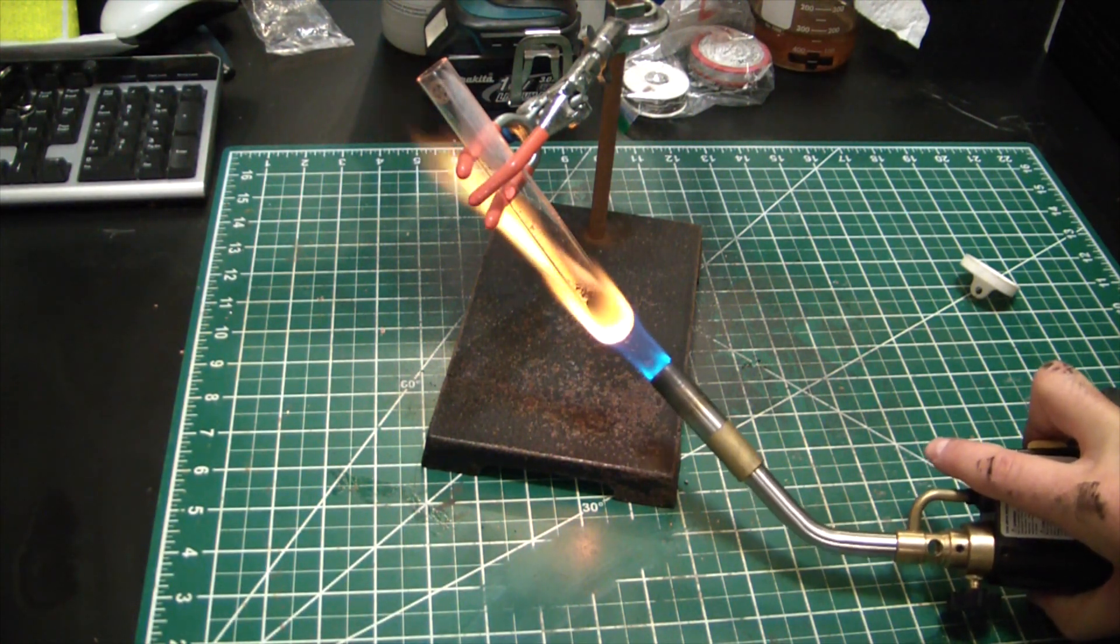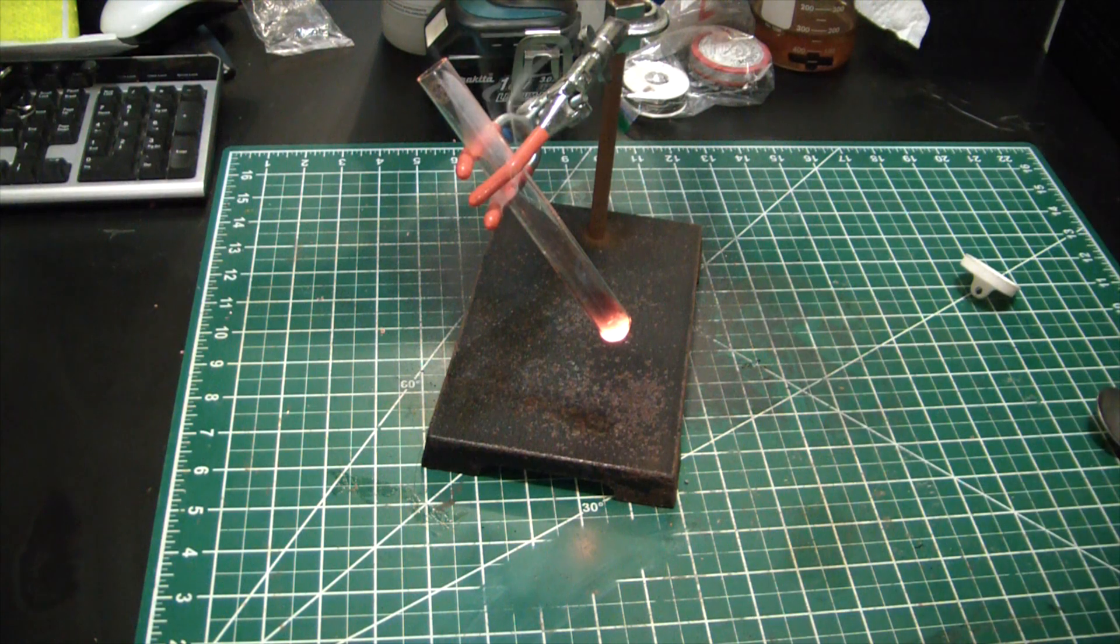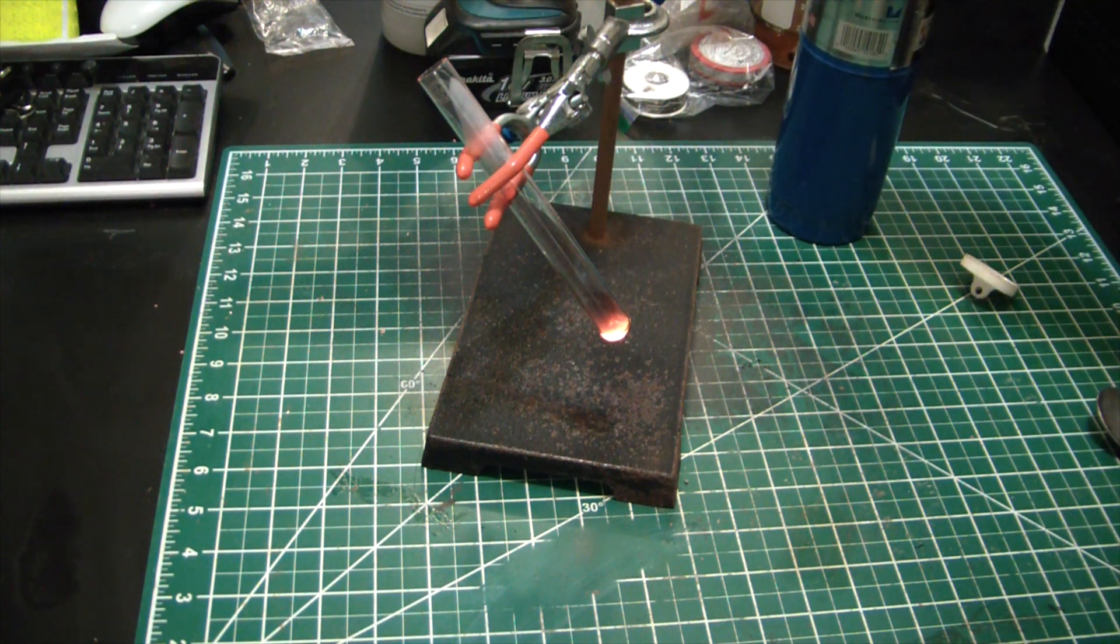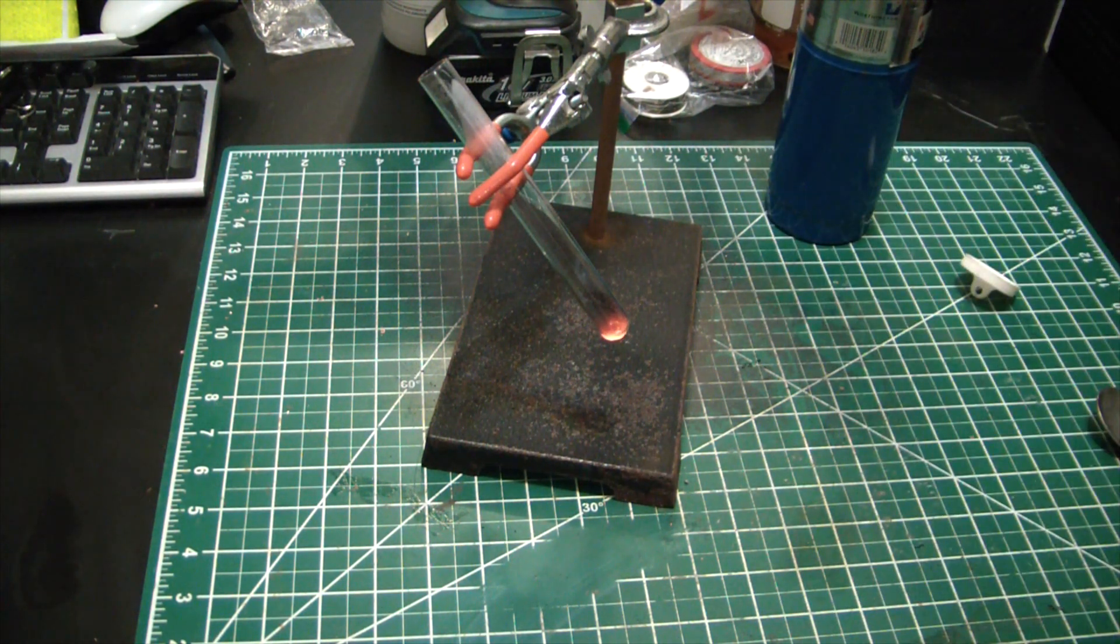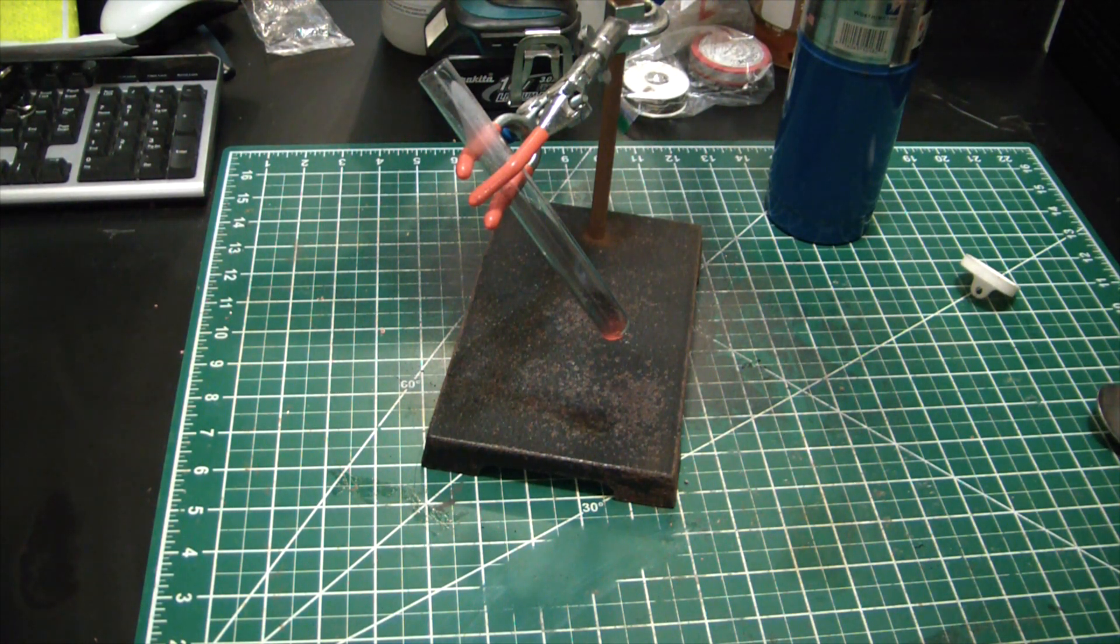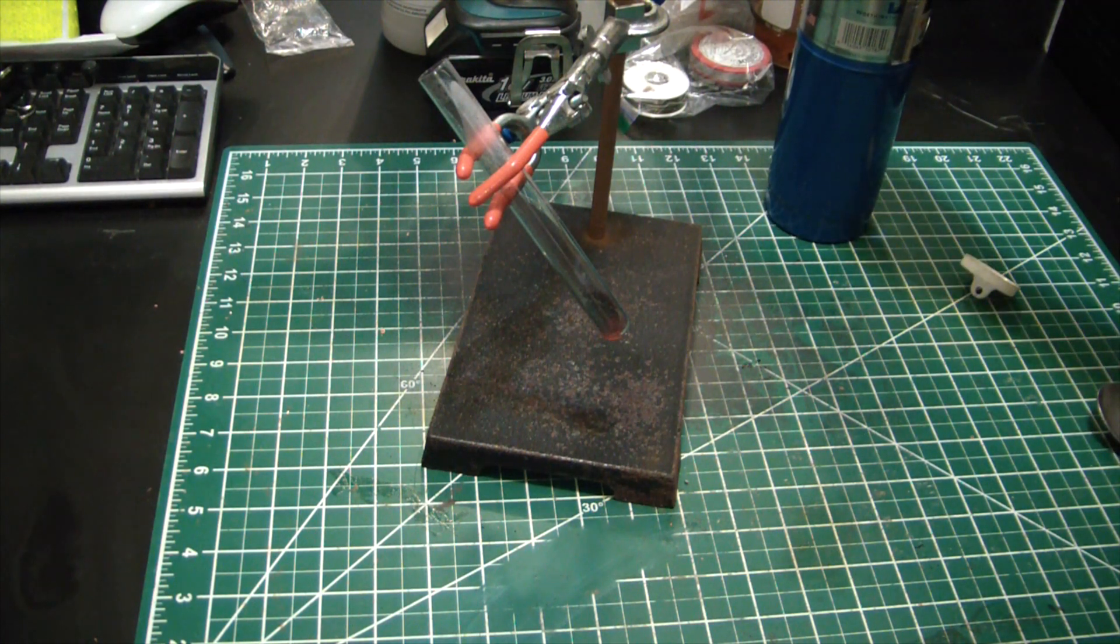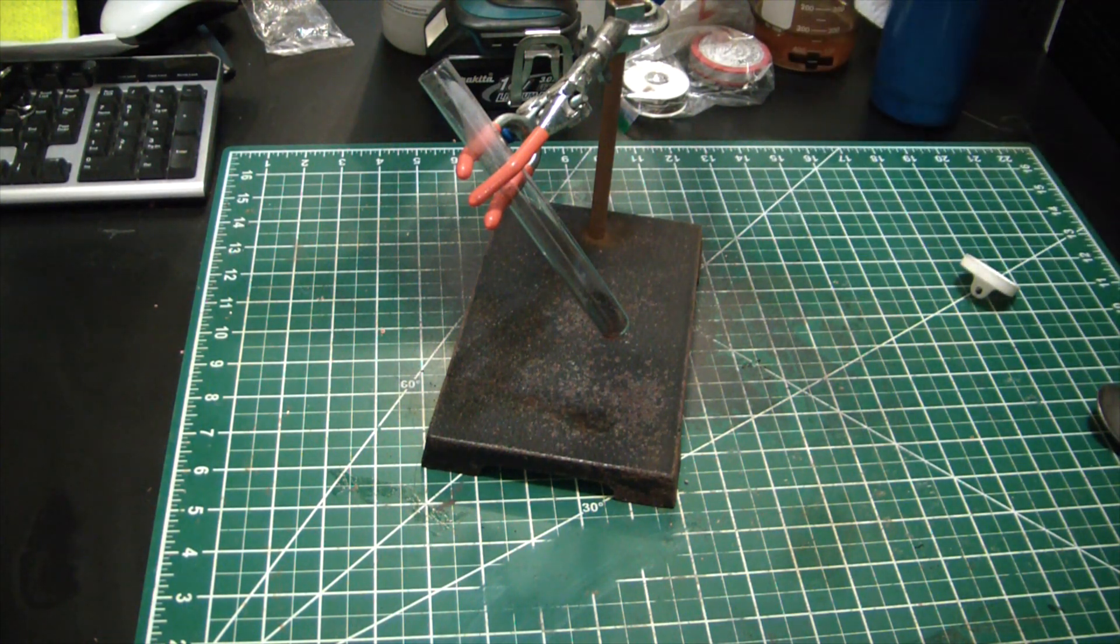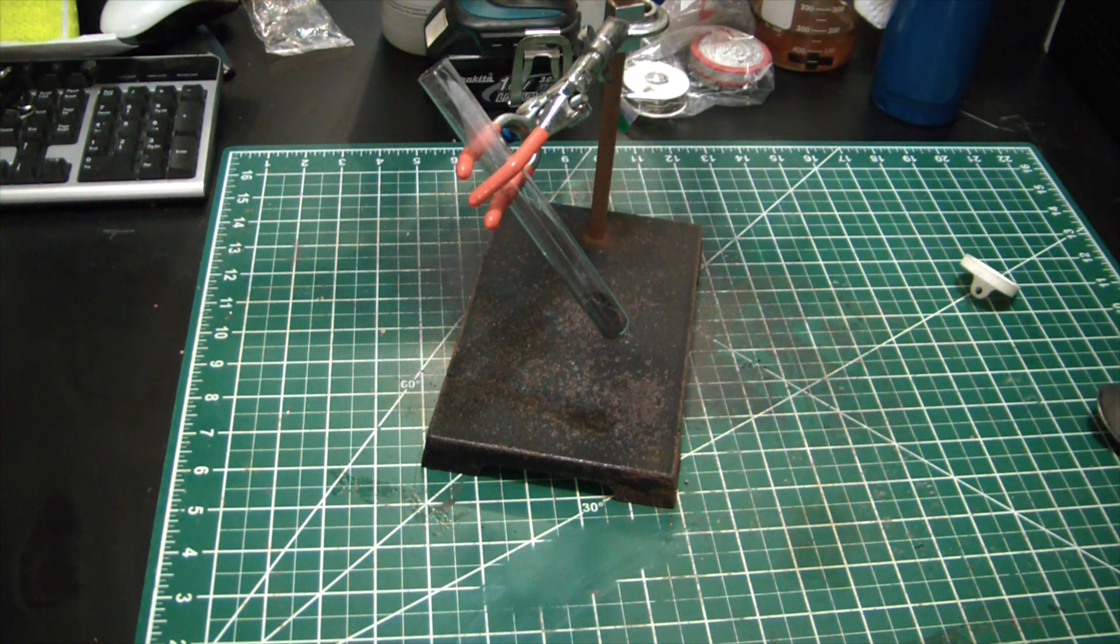Oh, I saw a reaction! I think we got it. Hopefully that extra layer of carbon will keep the carbide from being exposed to too much atmosphere, but I think it worked. That was way too easy. Holy shit, nothing's ever that easy.